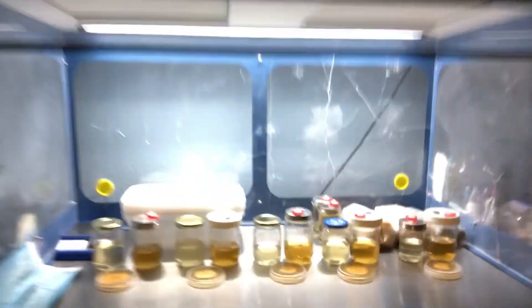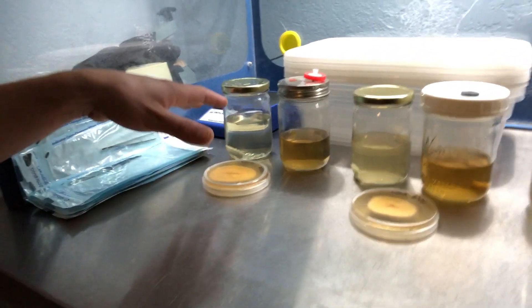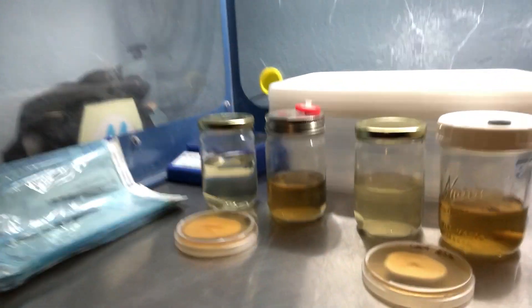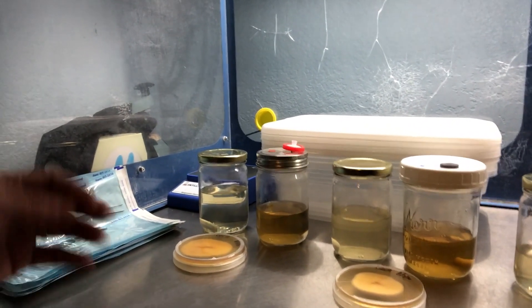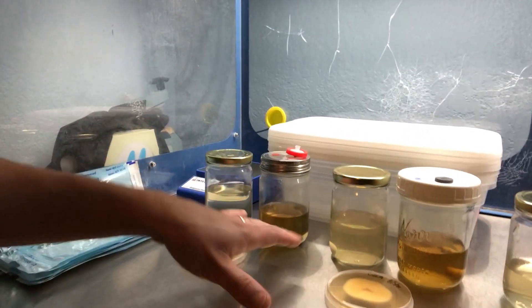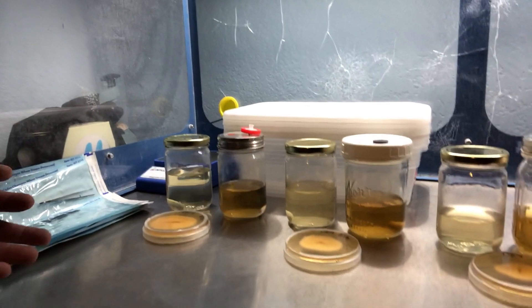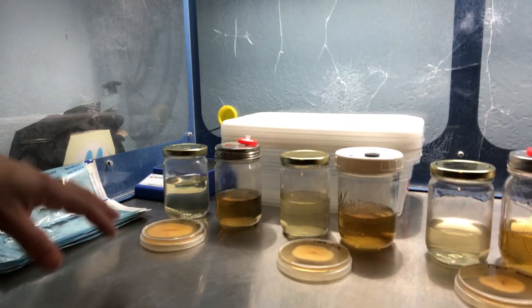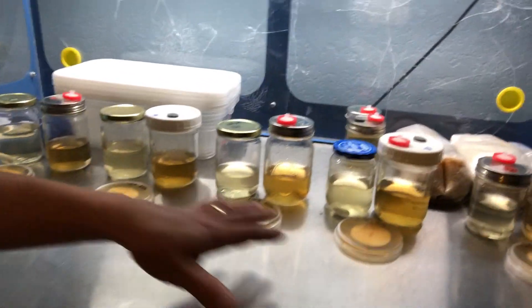I've got my different top five selections all laid out, and then I created this liquid broth — honey water on the left and the TSB on the right. You can see the difference in color and they're both pretty consistent as far as viscosity. Hopefully we get some better fruits with the trypticase soy because it will have protein added, and then we won't have to supplement our grains as much on the back end if we can create ideal broth for the cordyceps.